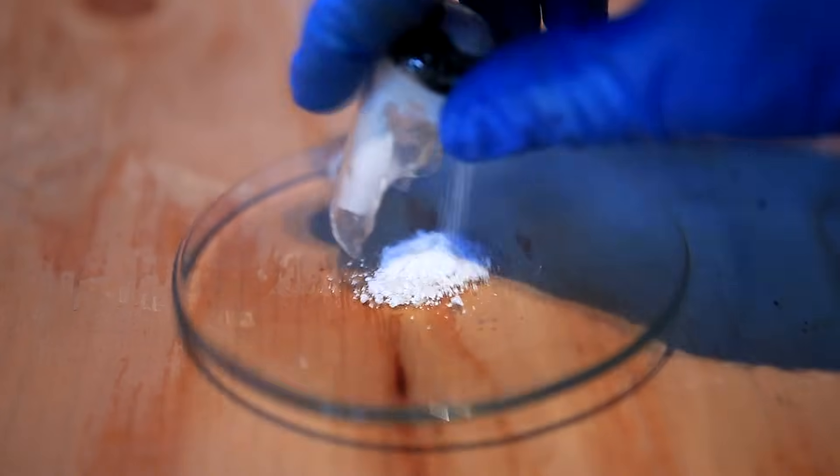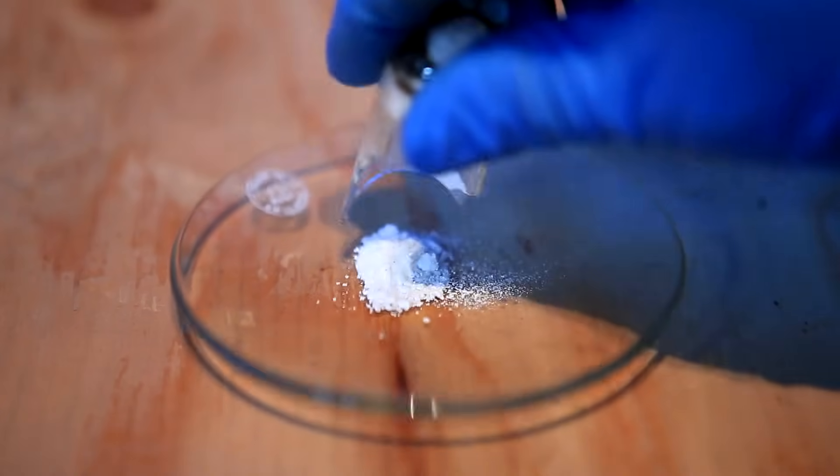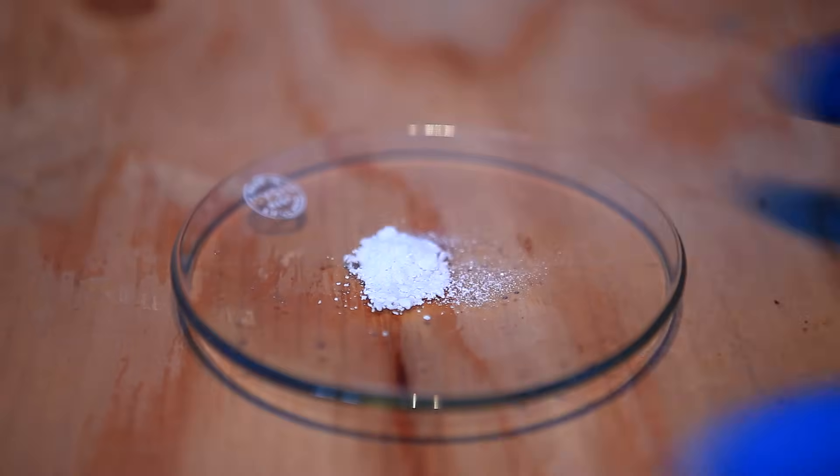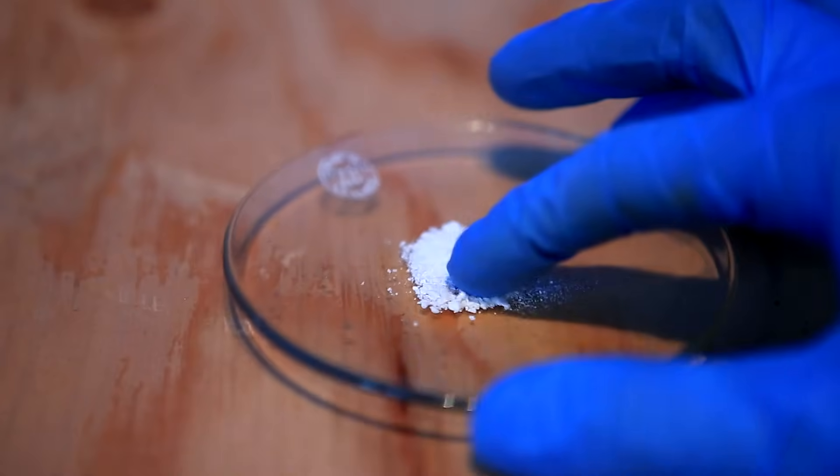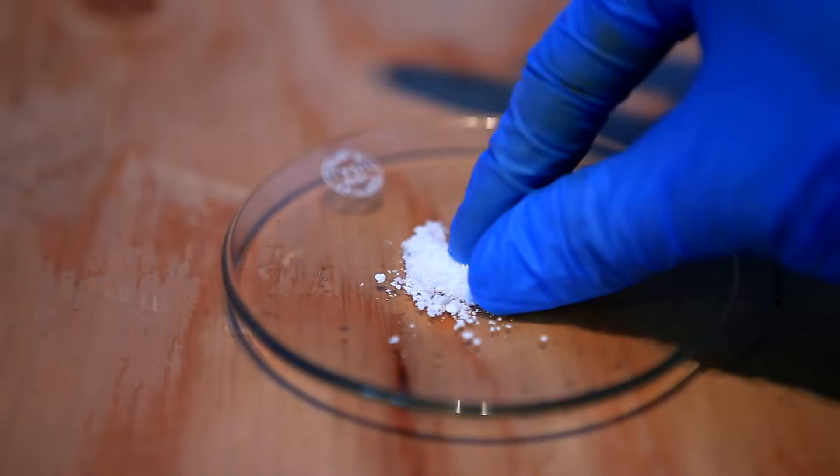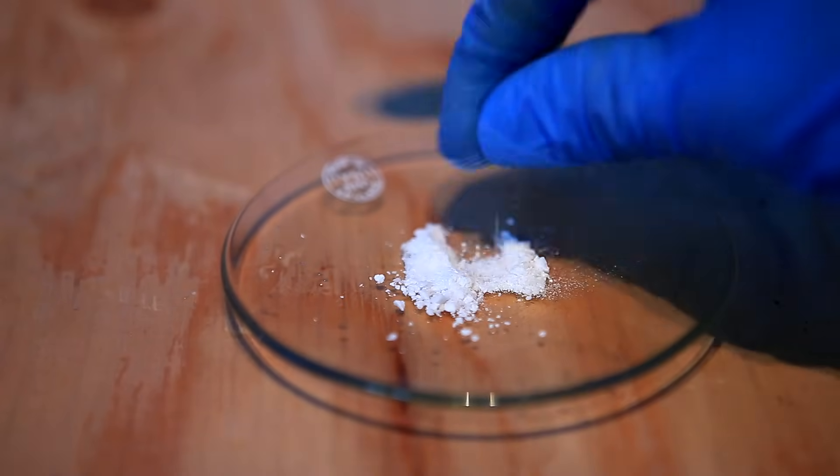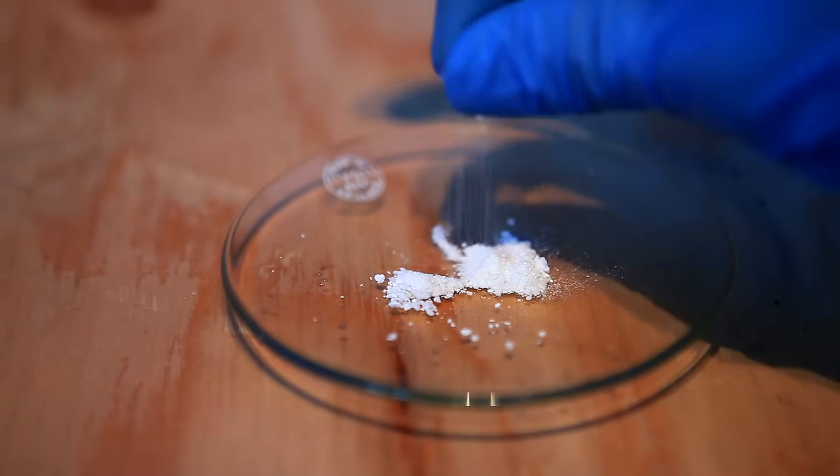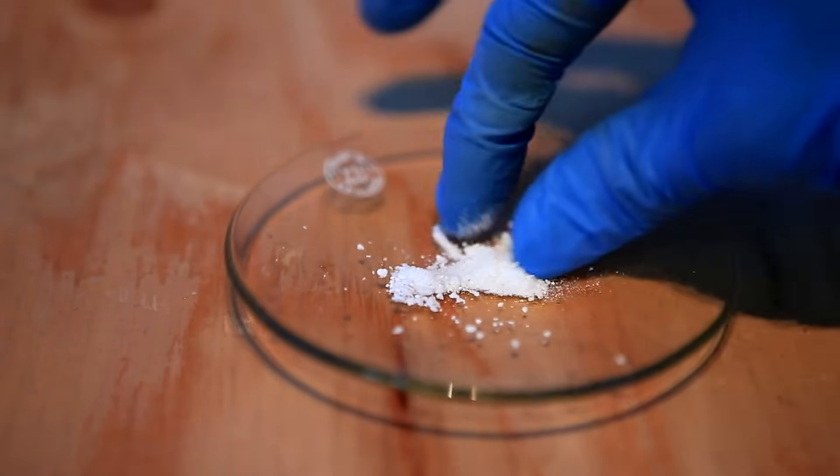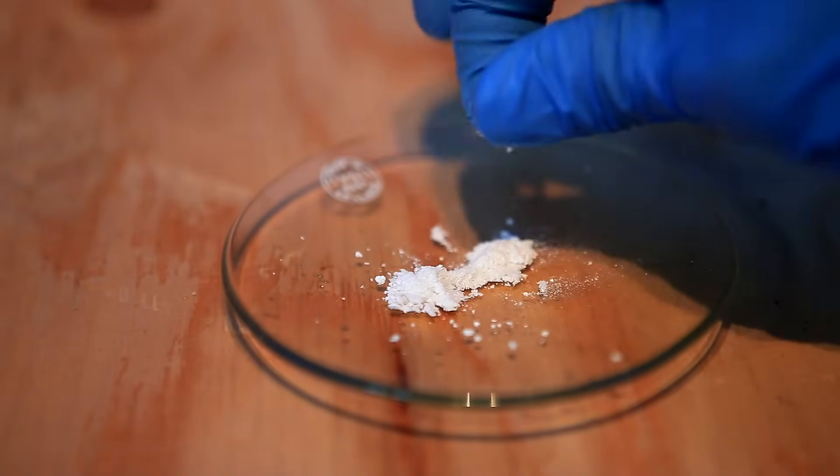When it's poured out, you can see that this product is much cleaner than the last run. This sodium chloride was surprisingly fluffy, maybe because it wasn't contaminated with so much sand. Although this product looked nice, white and clean, I still highly advise that you don't sprinkle this onto your food.